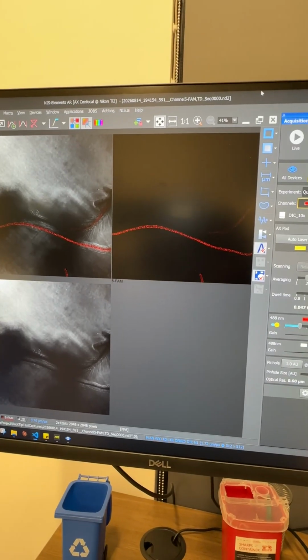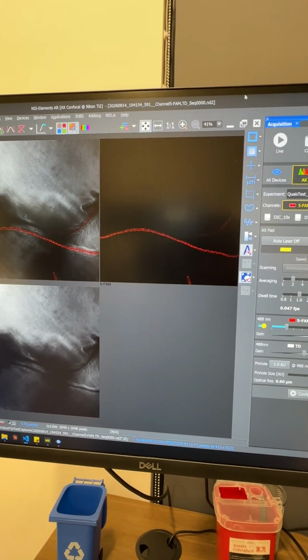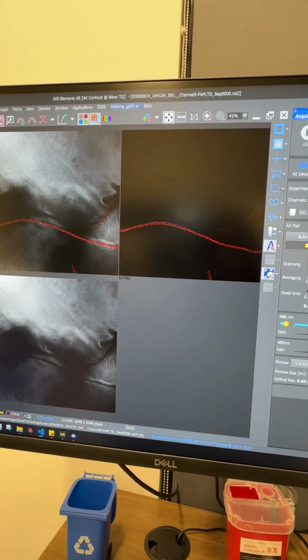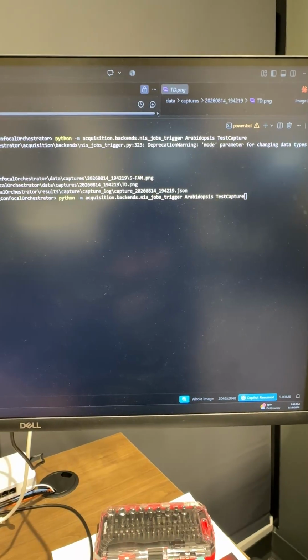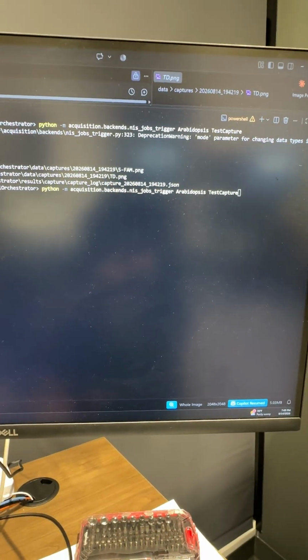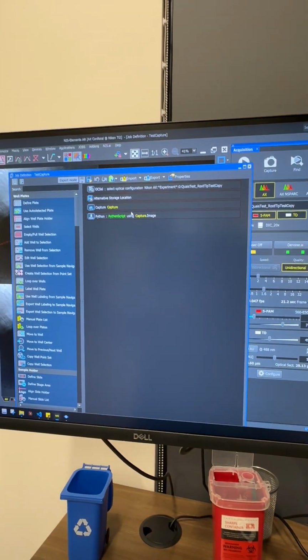Okay, so let me explain how I did this. The very first thing is I am not using any SDK for that, because this capture is done inside the NIS and not the Nikon SDK. So if you see here, through my script I am calling a test capture job. This test capture job I have created inside the NIS itself and configured a few things, as you can see here.